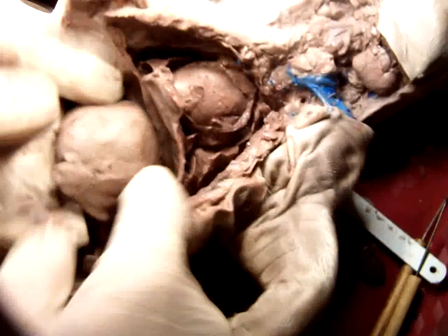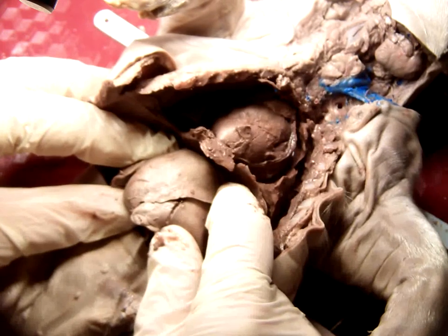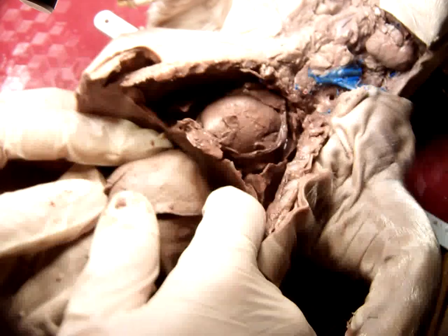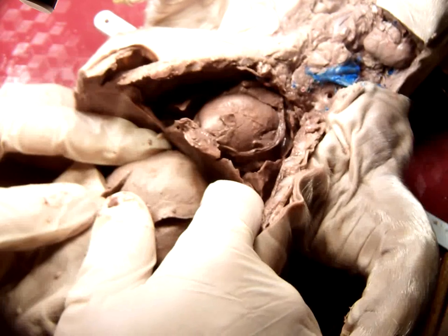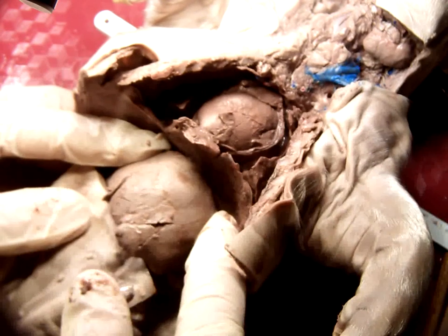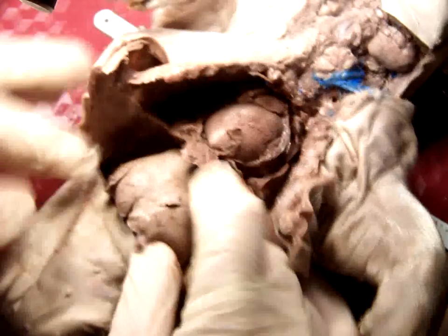And if you go right below that, you'll see this huge organ here. This one here is the what? This is the liver. Now, in most of the specimens, you'll see the liver is a darker color, but you can't count on color. Rely more on location, attachment, and texture rather than color. For the most part, the liver is going to be a smooth consistency, relatively rigid, about as rigid as the heart, much more rigid than the lungs.